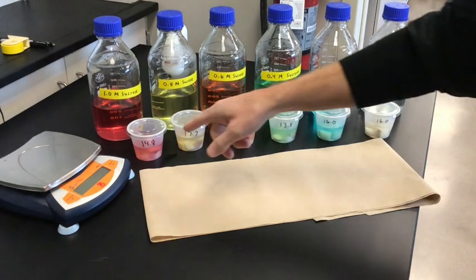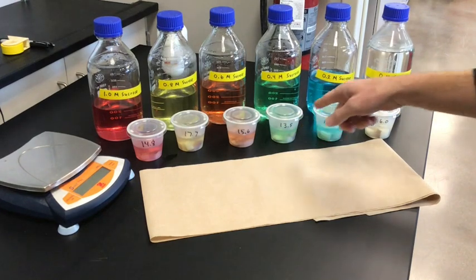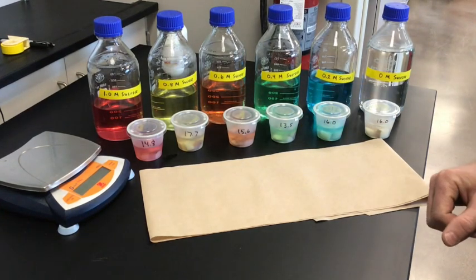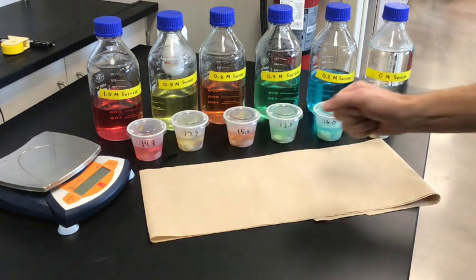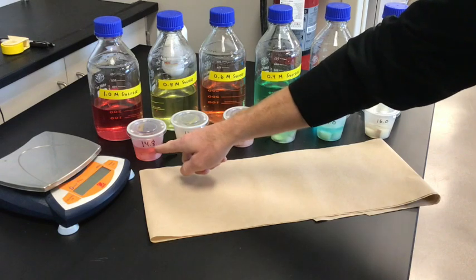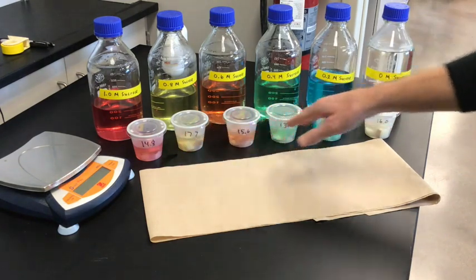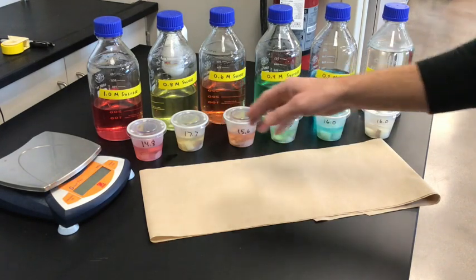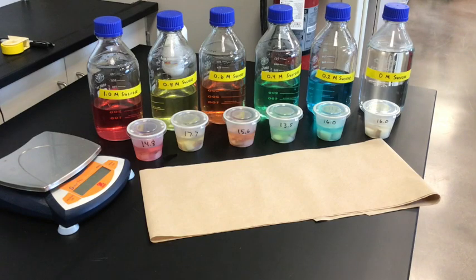So here we are — it's the next day. I'm going to go ahead and remove the potato chunks from each of the sucrose solutions, rinse them off really well, dry them off, and re-weigh them to see if the initial weights — like 14.8 or 17.7 grams — are going to be greater or lower than they were to start with.